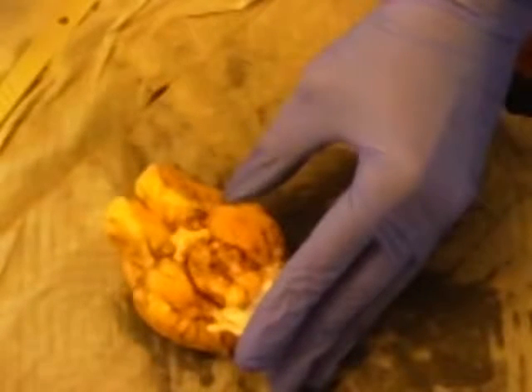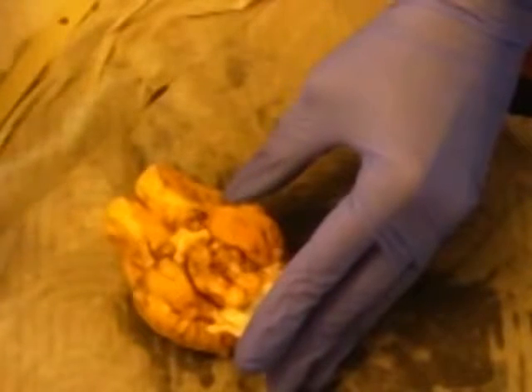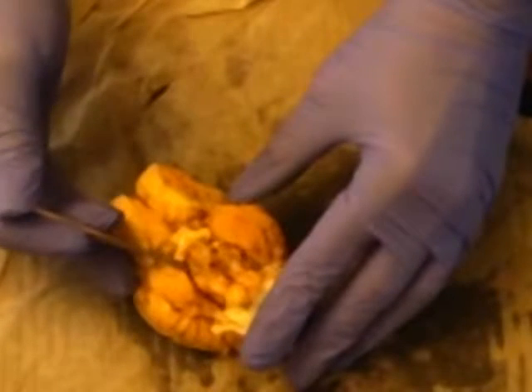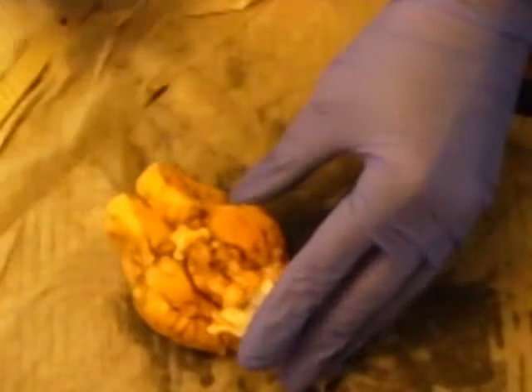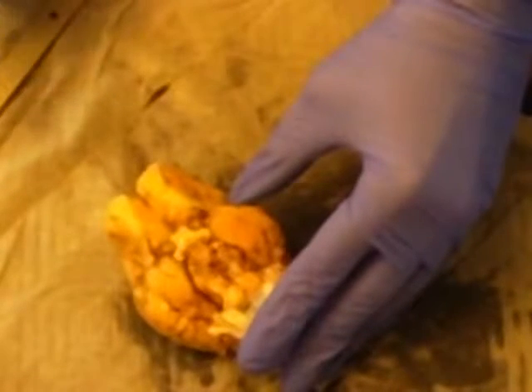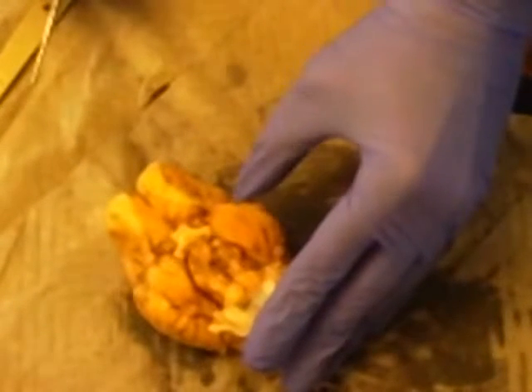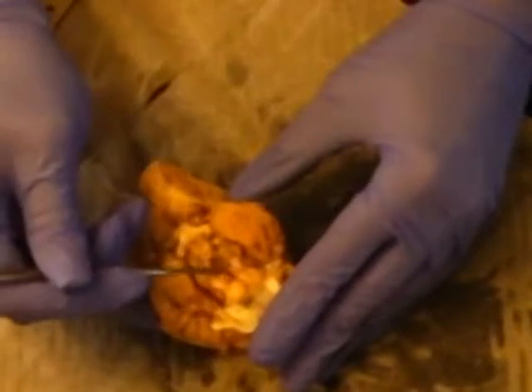Okay, so the oculomotor nerve is right here. You can see that right there. Then we have the trochlear nerve, which is these little branches over here. The trigeminal nerve, which is here, and the abducens, which is at the top of this little structure here.